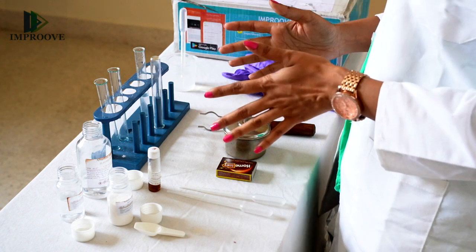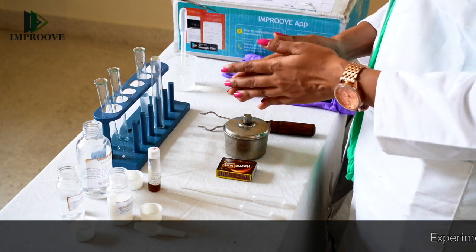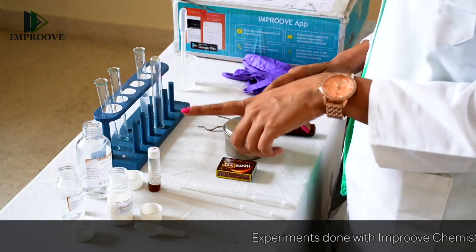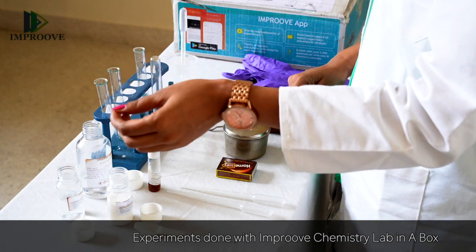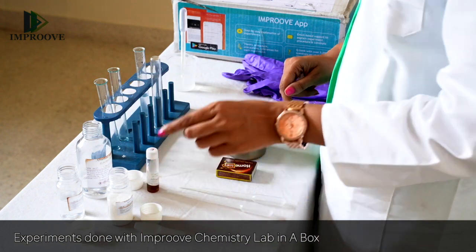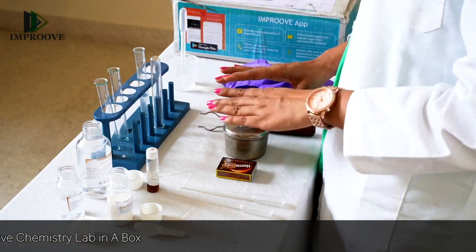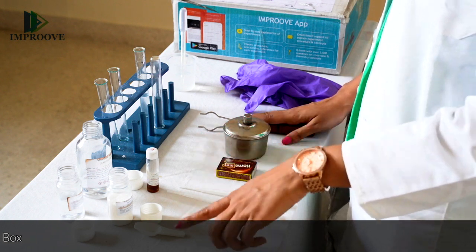For the experiment, you will need a test tube and a test tube stand. You will need ethanol — that is absolute alcohol in your kit. You will also need ethanoic acid, which is also known as acetic acid. And you will need concentrated sulfuric acid. Since you're going to deal with this, please ensure that you have your gloves. You will need a spirit lamp, a few droppers, a test tube holder, and a measuring spoon.